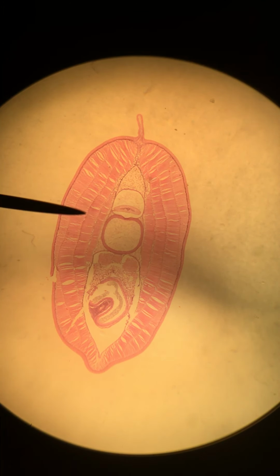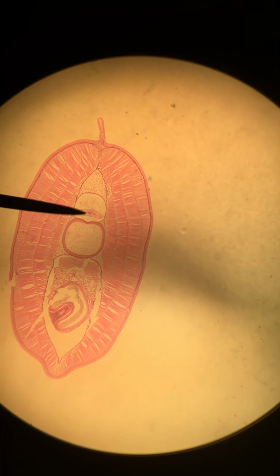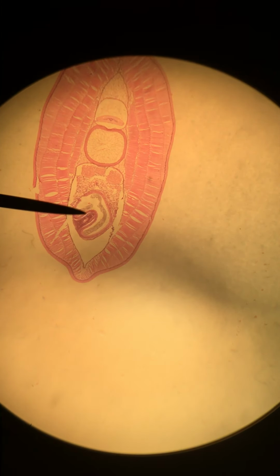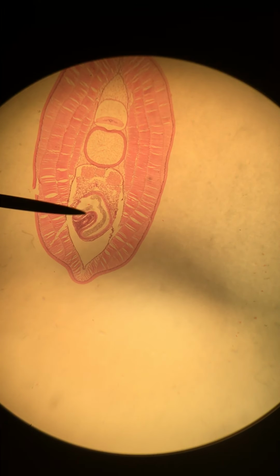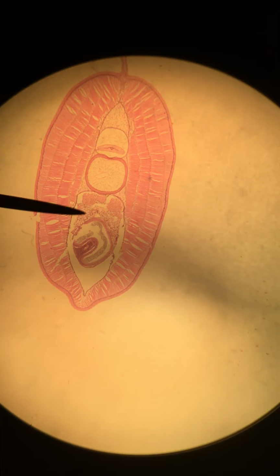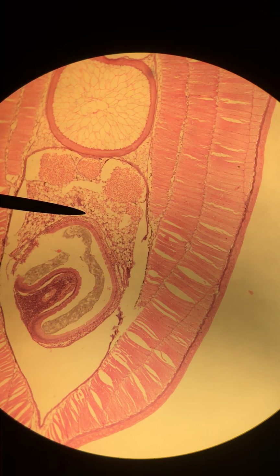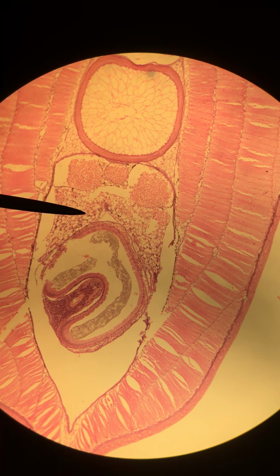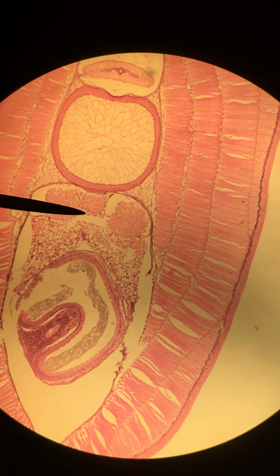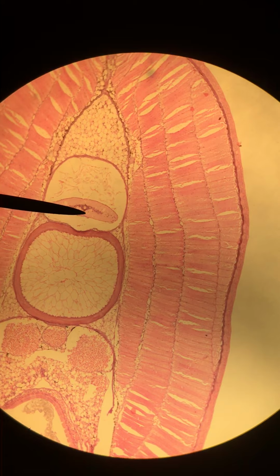Again, we've got lots of myomeres here. We've got our spinal cord and our notochord. On the ventral side, in the abdomen region, we're looking at the intestine. I'm going to zoom in to show you in more detail the kidneys and our dorsal aorta. Let me clarify that a little bit. Here are the kidneys. The intestine is here. And the dorsal aorta is here on the midline. And of course the notochord and spinal cord.